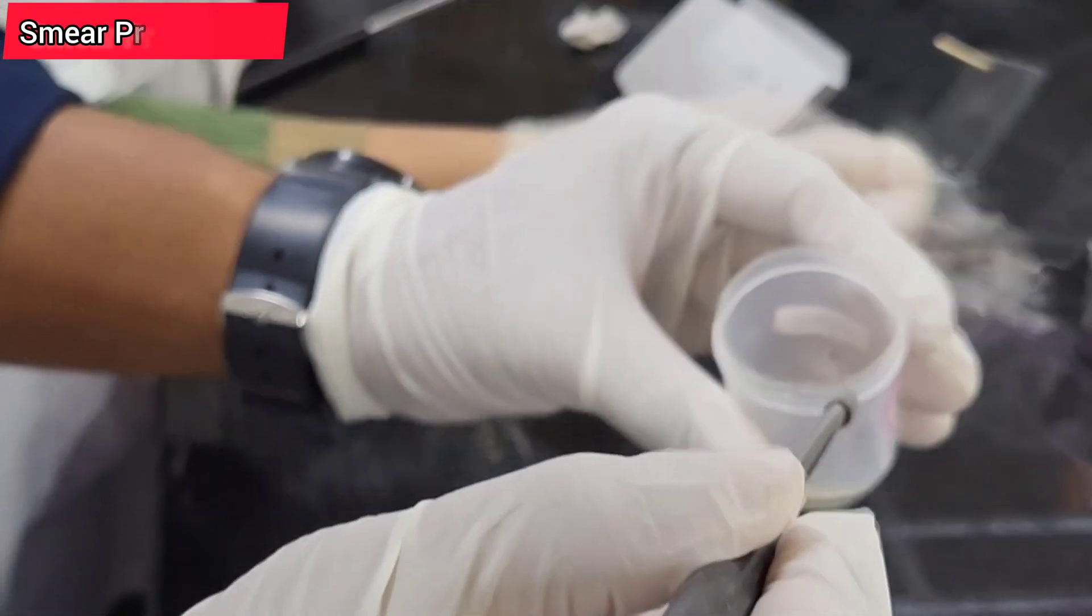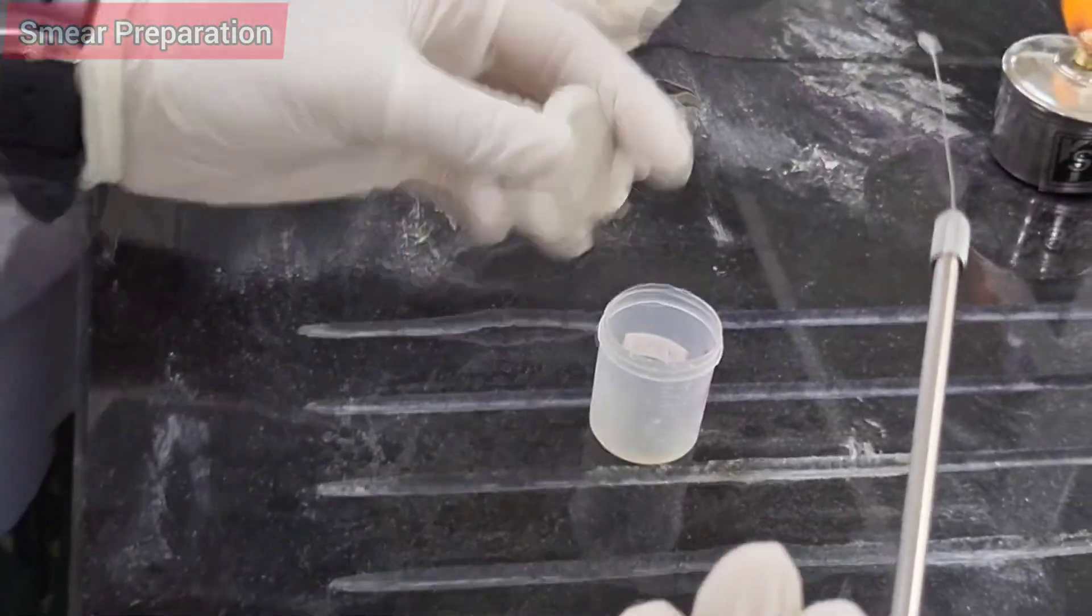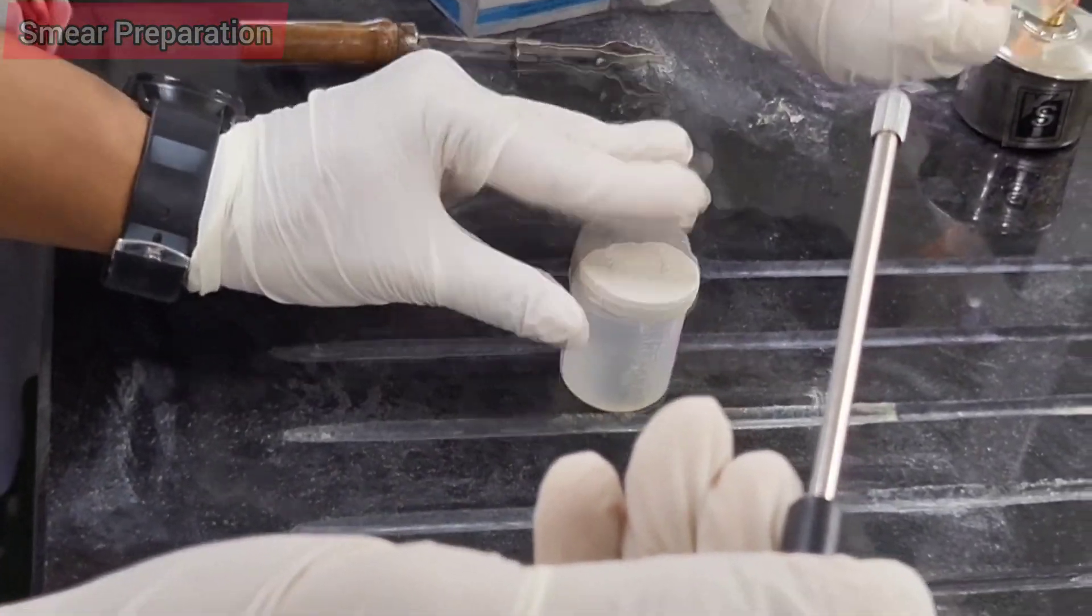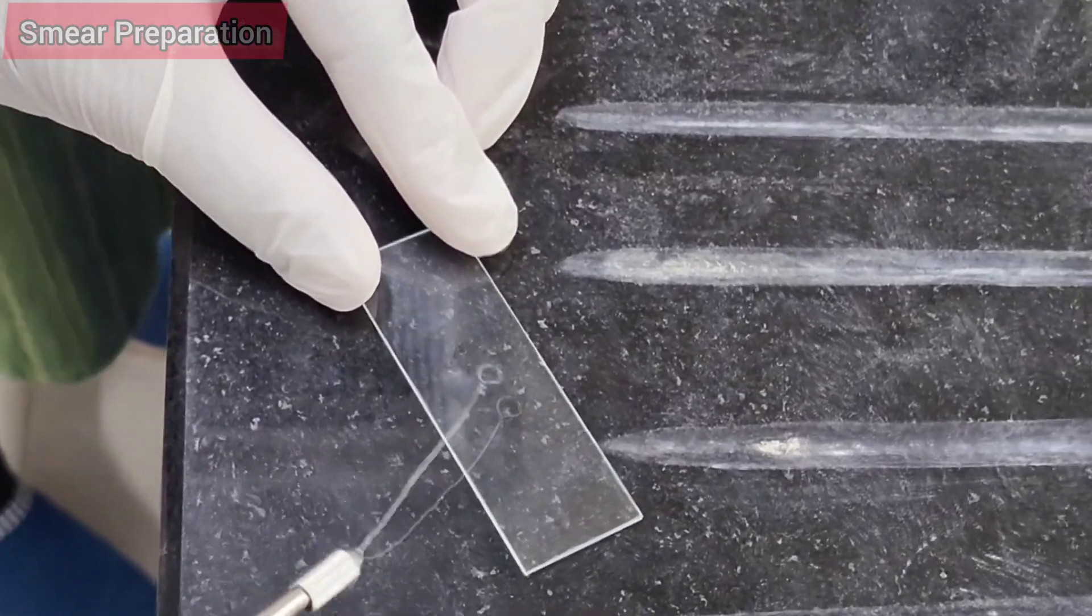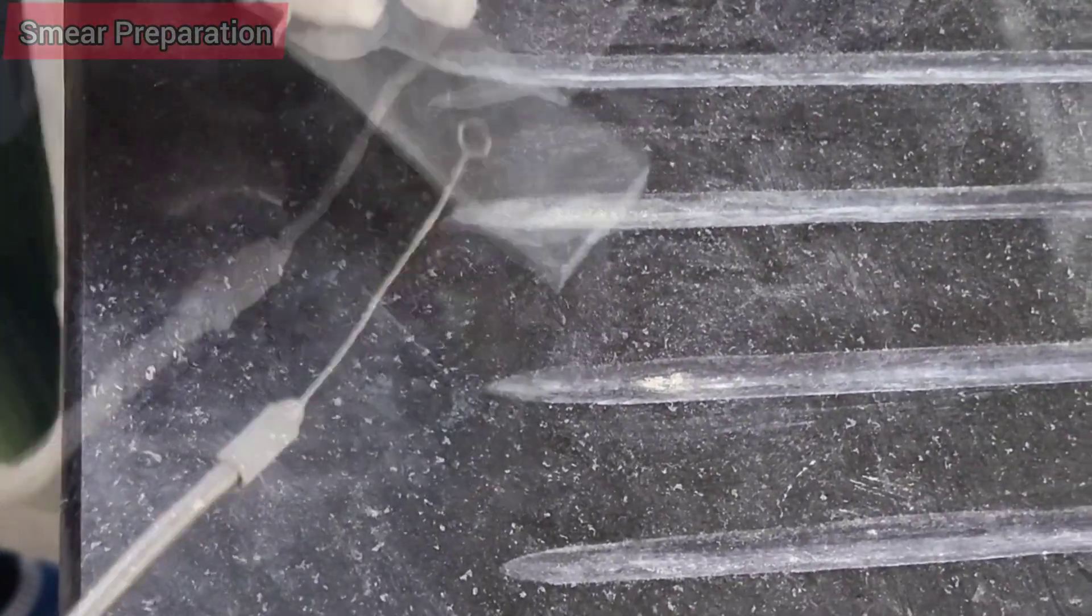Spread it thinly and evenly so that the smear should neither be too thin nor too thick. Smear preparation should be done near a flame.